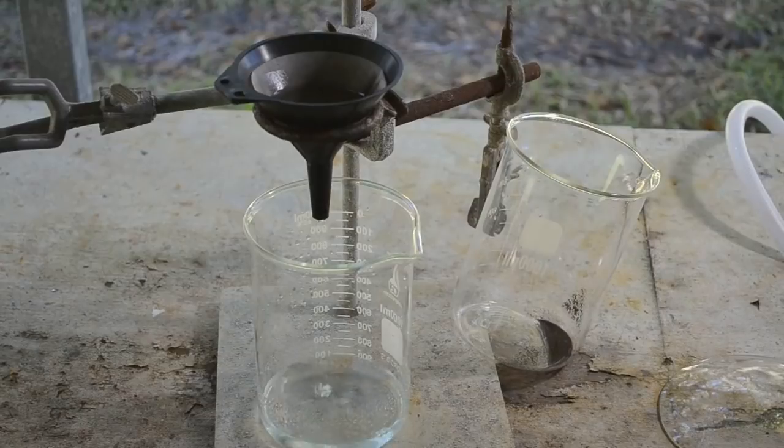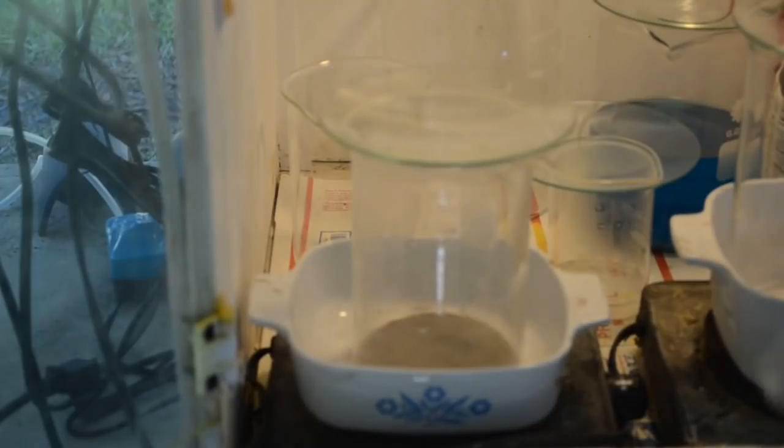So I'll wait for this liquid to go through, and then I'll combine everything in one beaker and redissolve it in aqua regia. Okay, so here we go. Let's get this gold cleaned up.